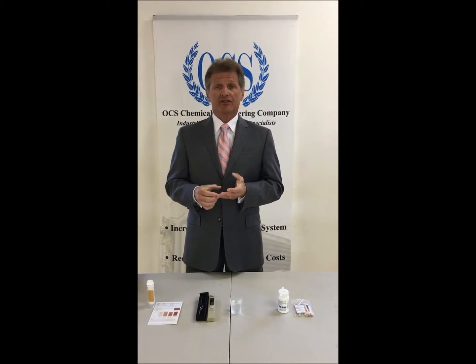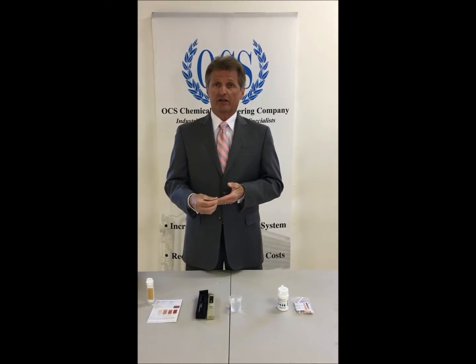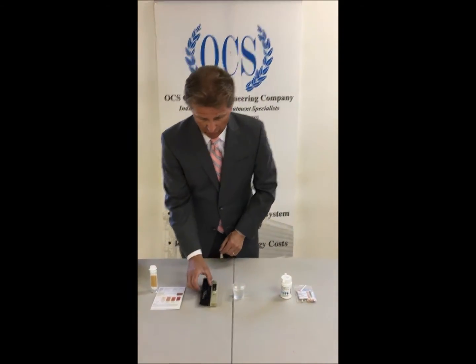Welcome back. We're now at part 2 of the OCS chemical engineering training for your on-site testing relative to local law 77. The tests we have to do again 3 times a week are the water chemistries. Those chemistries include pH, conductivity, temperature, and free chlorine. The test kits in front of me will handle all the tests we're going to need to do, so let's look at it first with the conductivity controller.